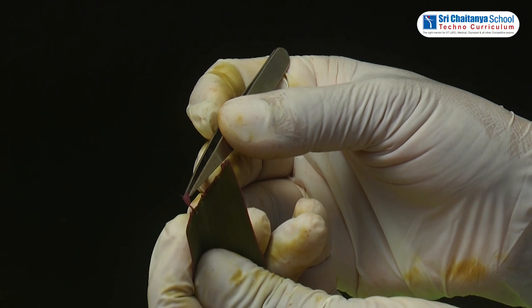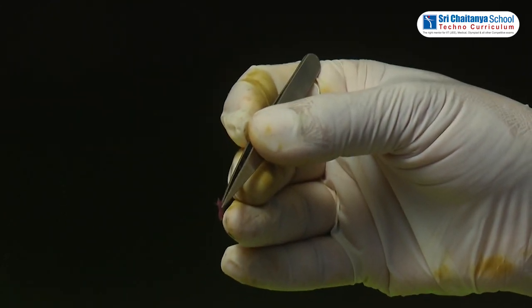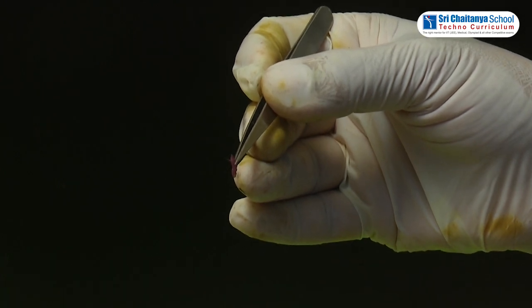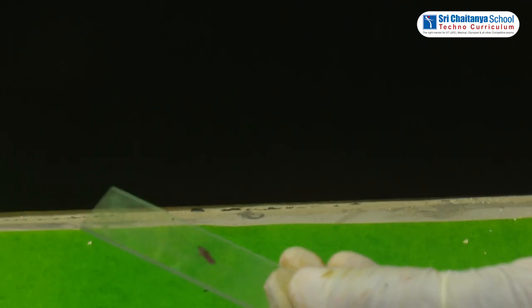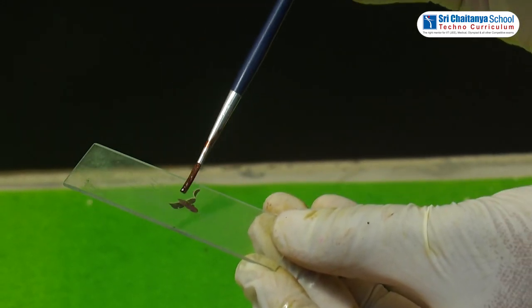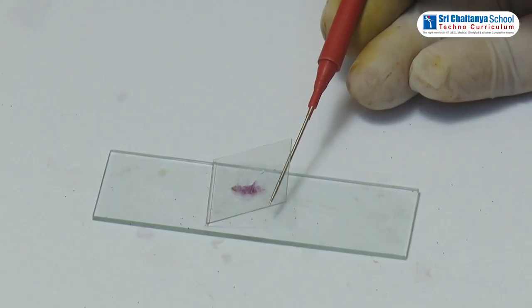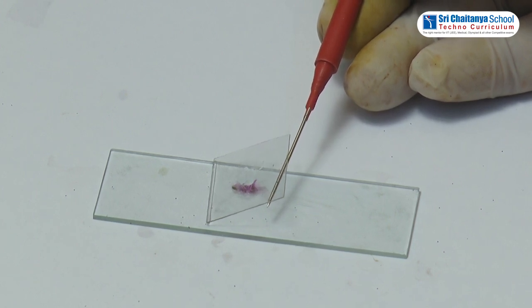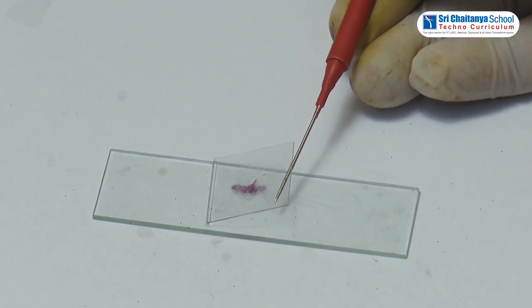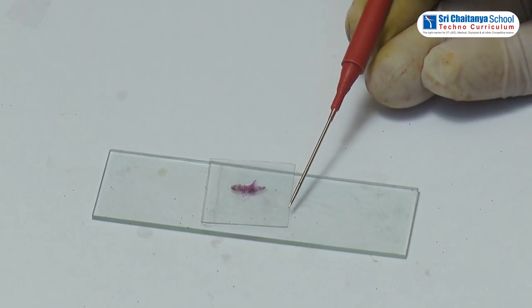Select the thin layer with the help of forceps and place it on the glass slide. Put a drop of water on it, then cover the section gently with a cover slip.